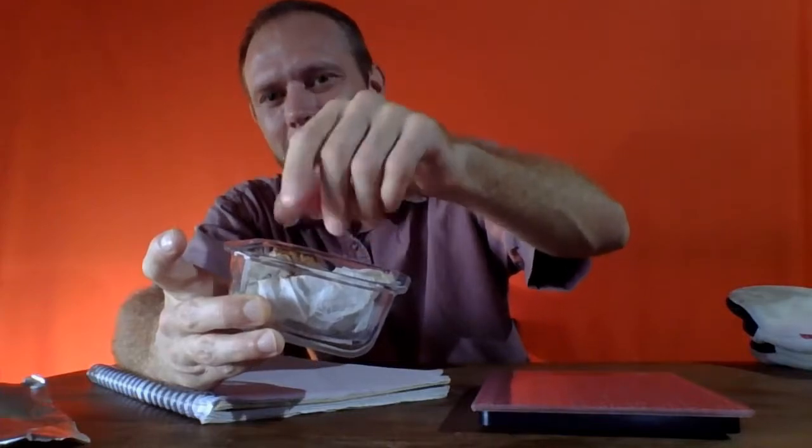I'm having a difficult time breaking them apart. That's due to the crystals of salt that have sort of frozen all that sand together. Normally the sand would just be sand and wouldn't be clumped up like that. So apparently we did not achieve a perfect situation. There's a lot of sand in there, but I can see that there is also a little bit of salt, and that our separation is not perfect.